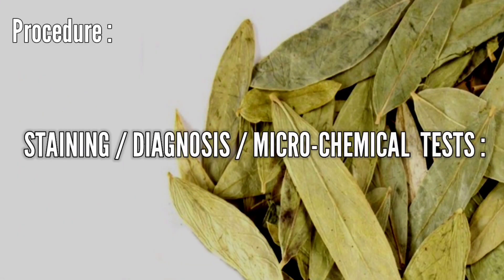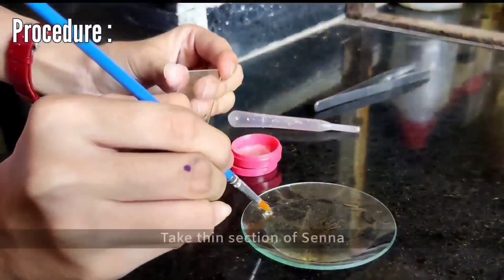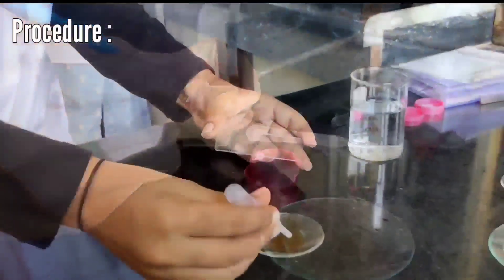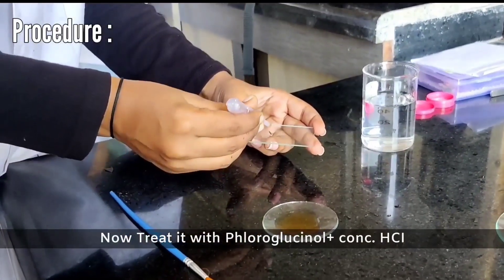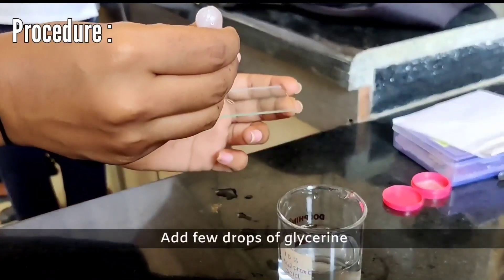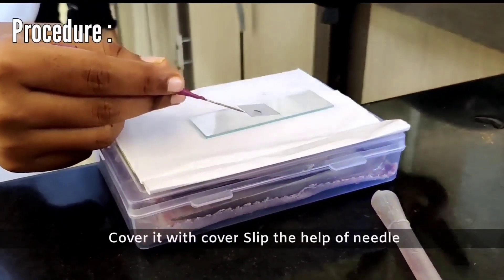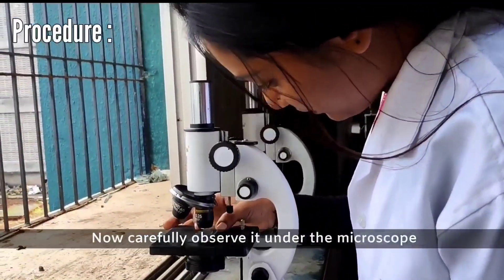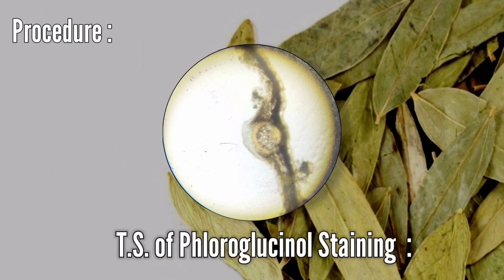Staining or microchemical test — Phloroglucinol plus concentrated HCl: Take a thin section of Sena. Treat it with phloroglucinol plus concentrated HCl. Add a few drops of glycerine on it and cover with the cover slip. Carefully observe it under the microscope. The TS with phloroglucinol staining is observed.